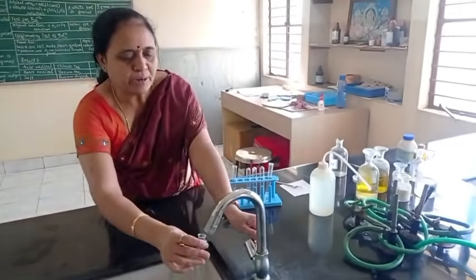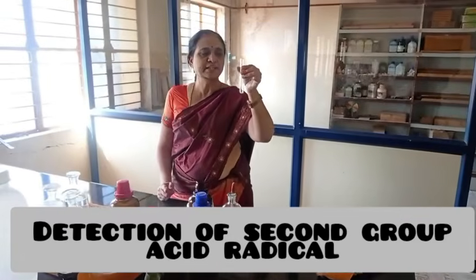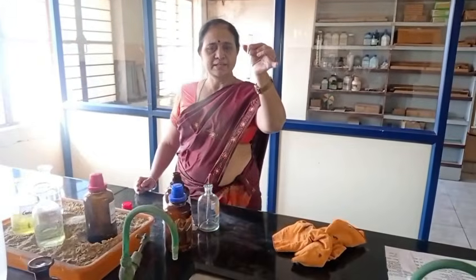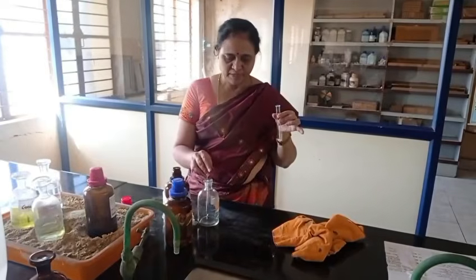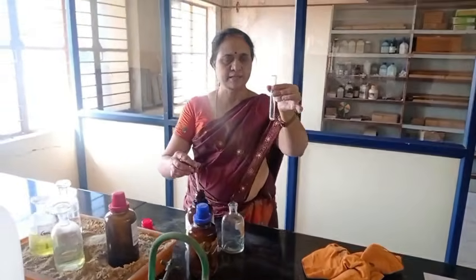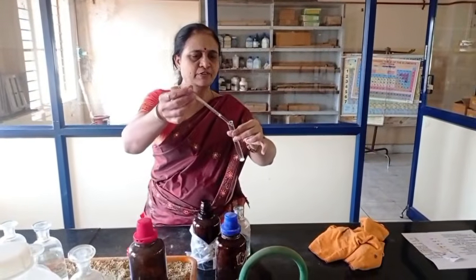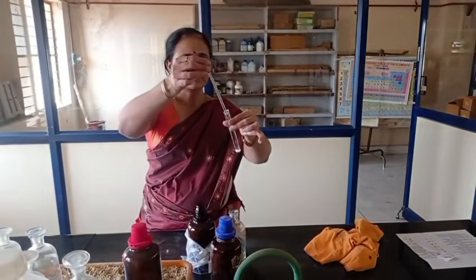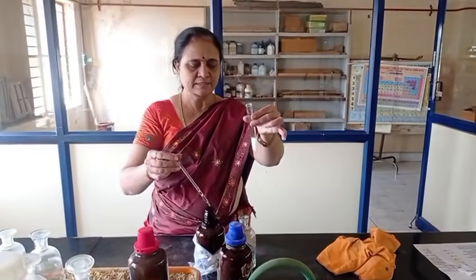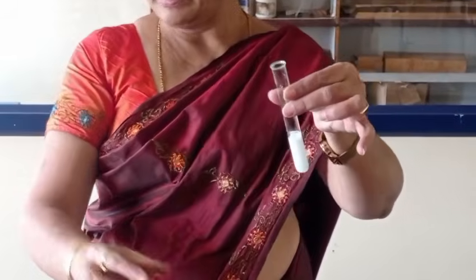Now, we have to check for second group acid radical. I am taking a salt in a dry test tube. I am adding concentrated sulfuric acid to this. See here, what happens? I am getting colorless vapors.